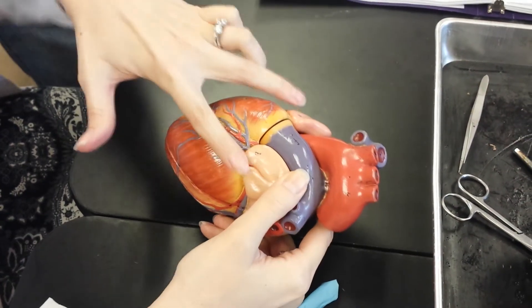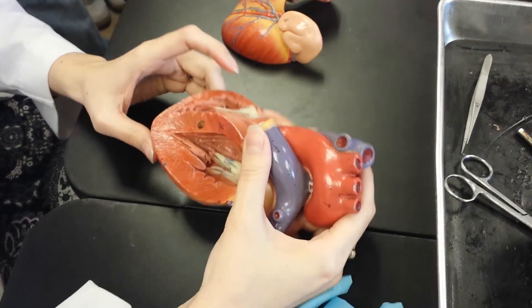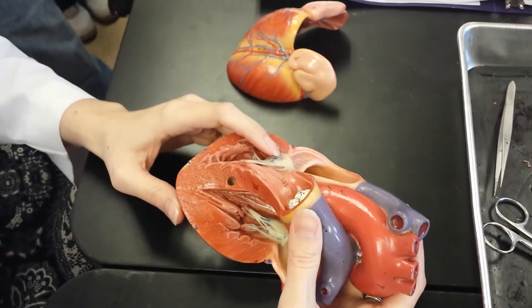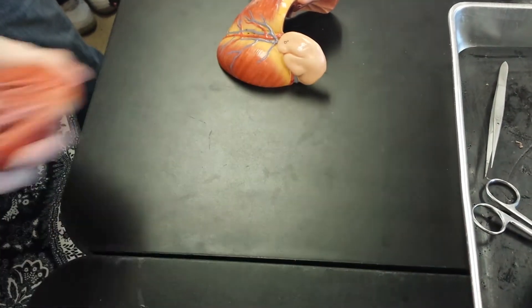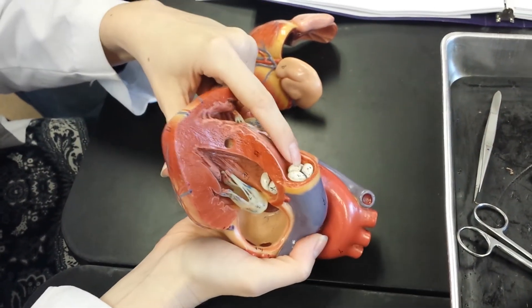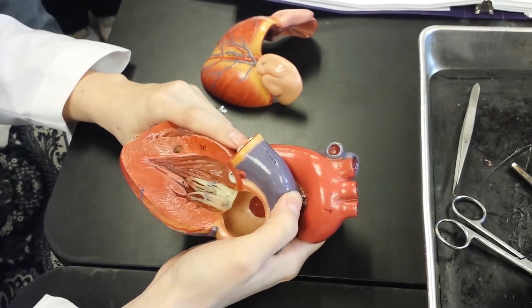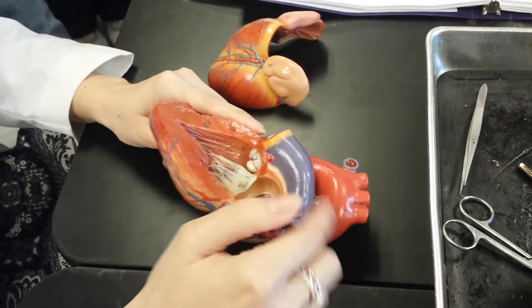These are our atria here; down here would be our ventricles. If I open it up, you can see this valve — that's the tricuspid, because it's on the right. Remember, this is your patient's right side over here, so this is the tricuspid valve and this is the bicuspid valve. That's going to be the pulmonary semilunar valve here, because this is your pulmonary trunk and the pulmonary arteries.